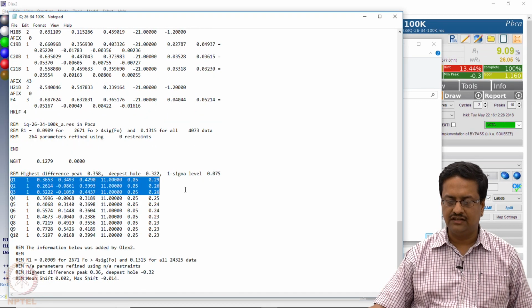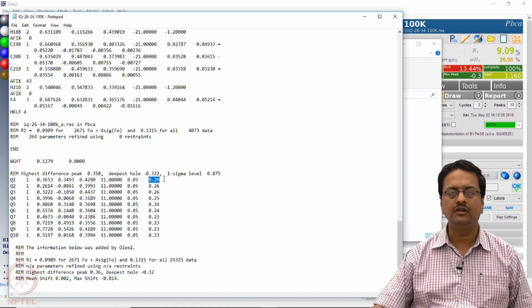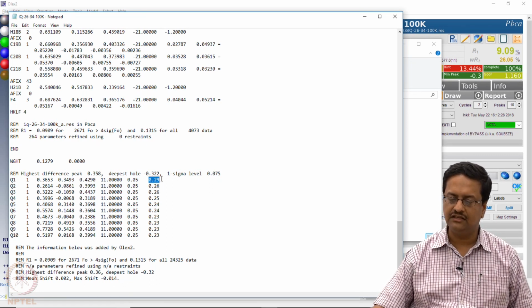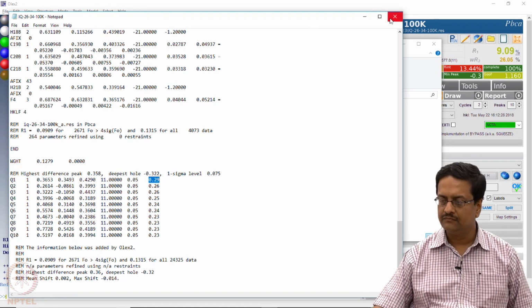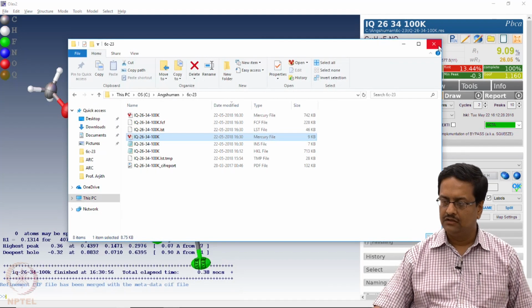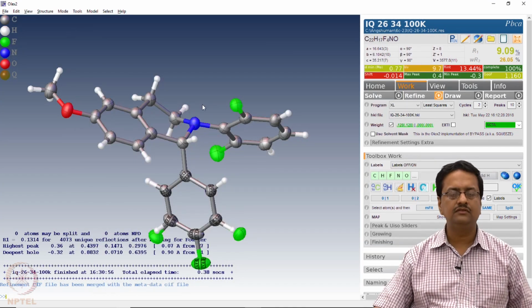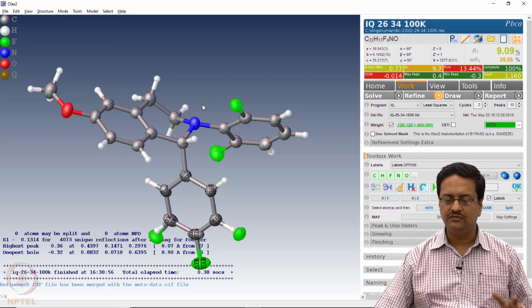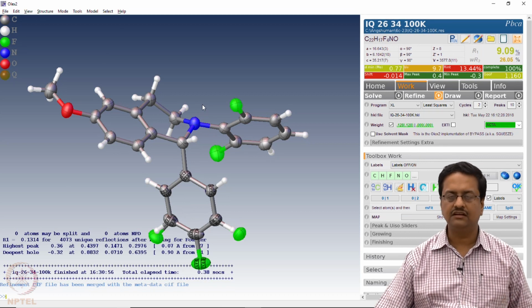The residual electron densities that are coming here are extremely small. These are all very small values for a light atom structure, and hence we don't need to do anything further. This indicates the structure is fully solved and refined well, and we have the R factor of about 9%. So with this we conclude this section of our discussion on structure solution and refinement using standard data, using different crystal data sets which we have learned now.